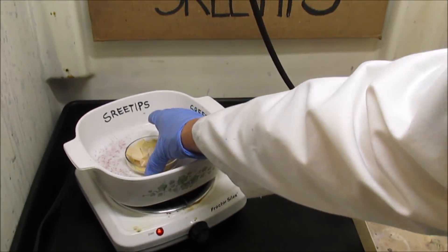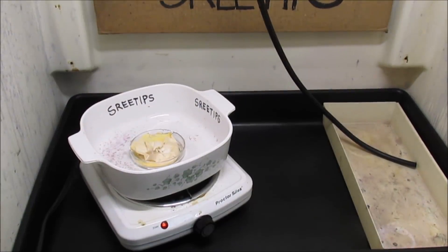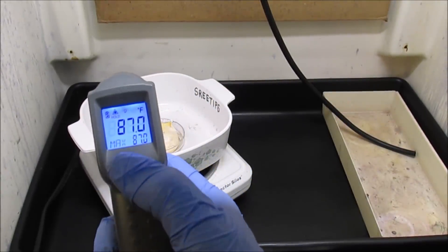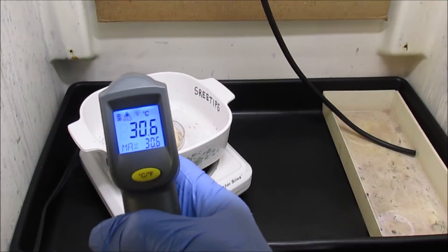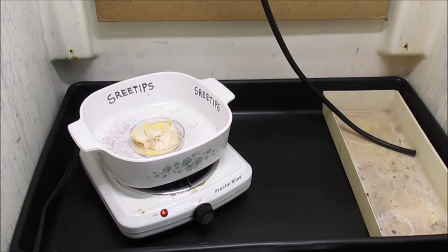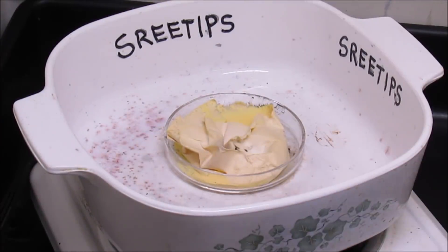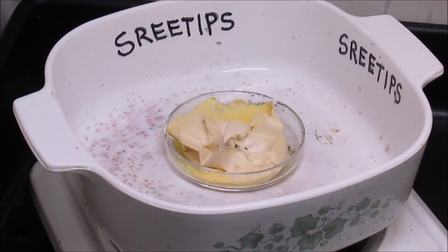The starting temperature is 87 Fahrenheit, 30.6 Celsius. I'm just going to turn the heat on and let this burn up. Let's go ahead and start this experiment by putting medium heat to this, see if we can burn off the ammonium chloride and get our pure palladium sponge.